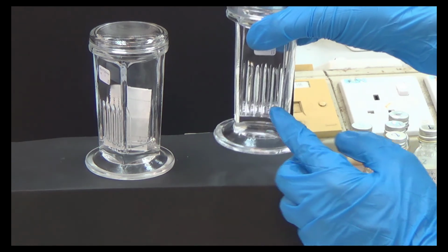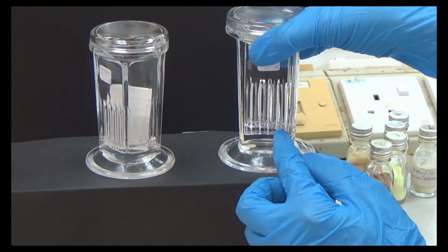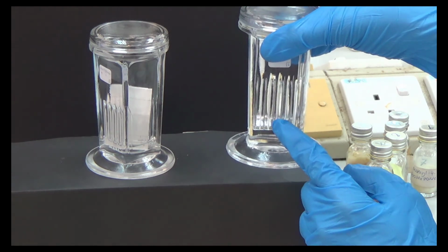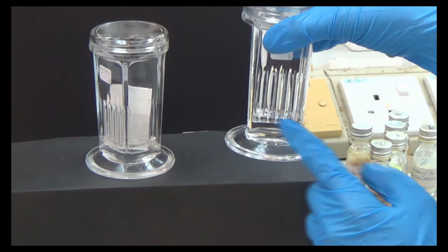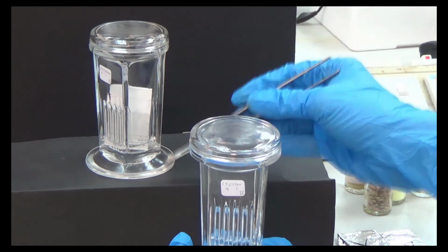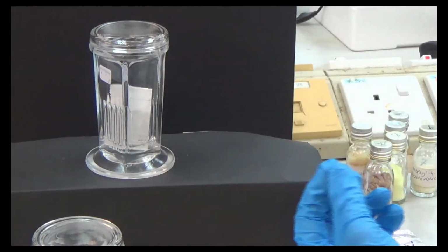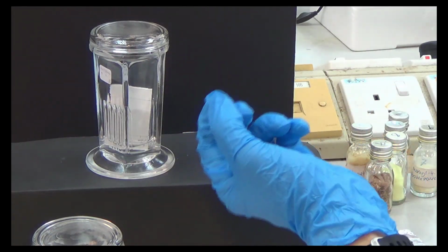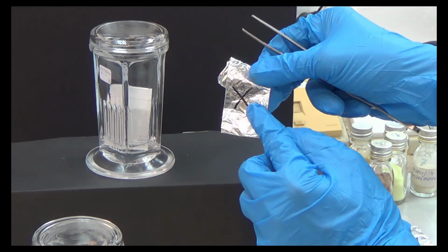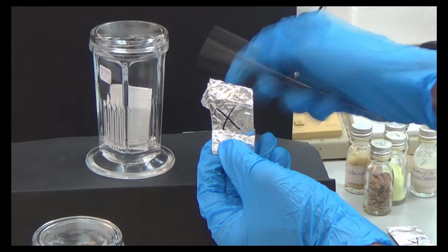Just this mobile phase can move. That's the difference. If you make this mobile phase more polar or more non-polar, depending on what you want, it will rise at a different rate, and this is important because if you have something very polar, for example, let's say this compound X is very polar, it will grip on the silica gel very tightly.